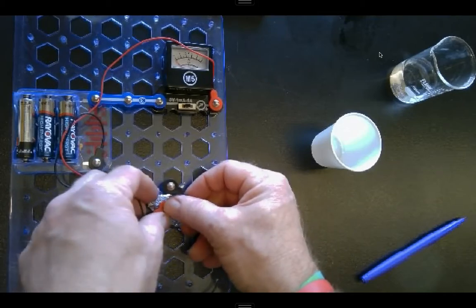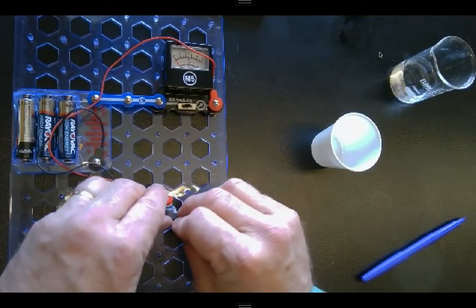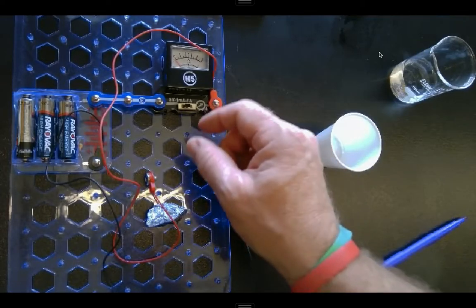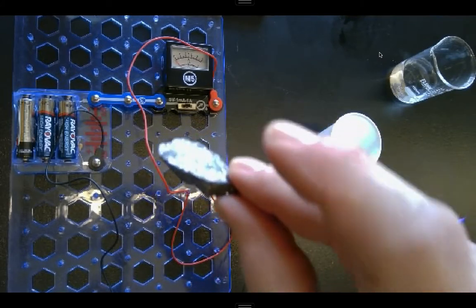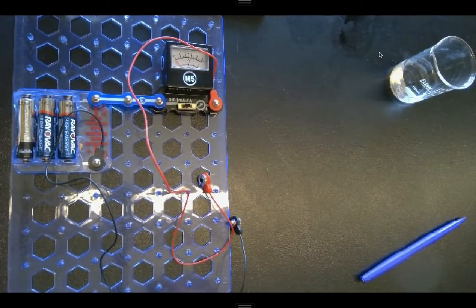I can try on opposite sides. All right, but still very little coming from the silicon. And so that is silicon, just showing you that metals, or what looks to be a metal, can be deceiving at times. Next, it's going to ask me to measure the pencil marking.